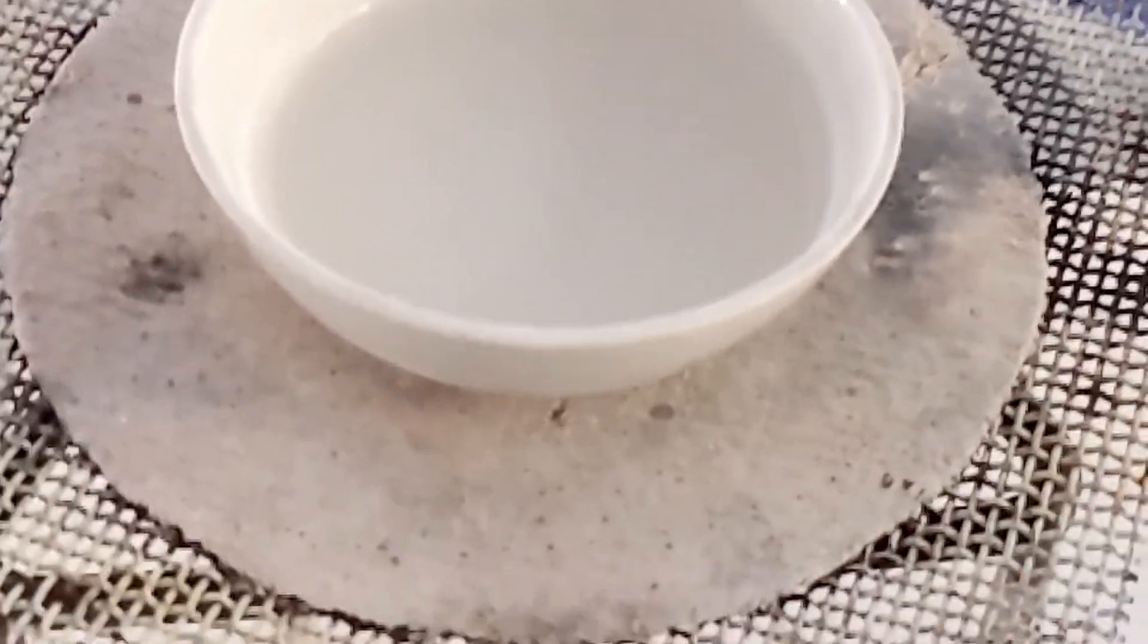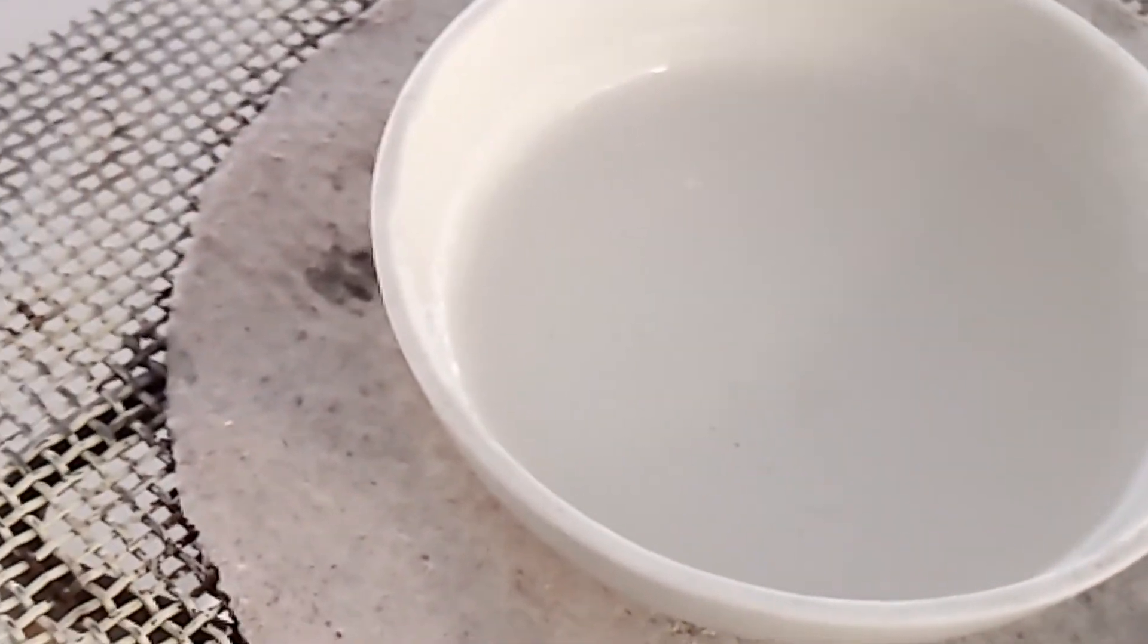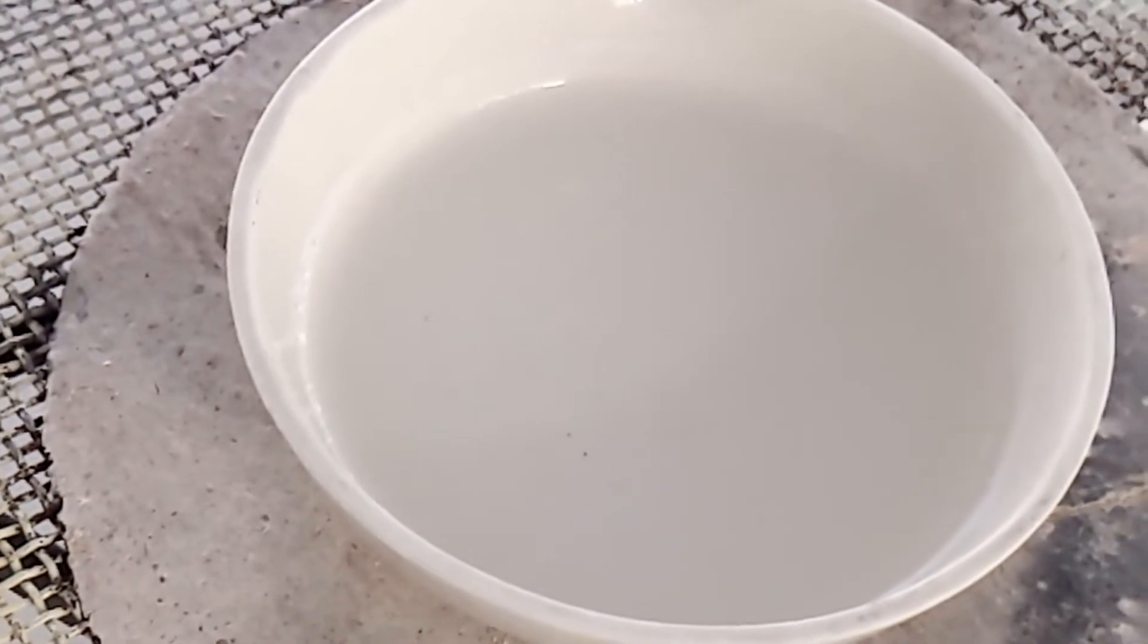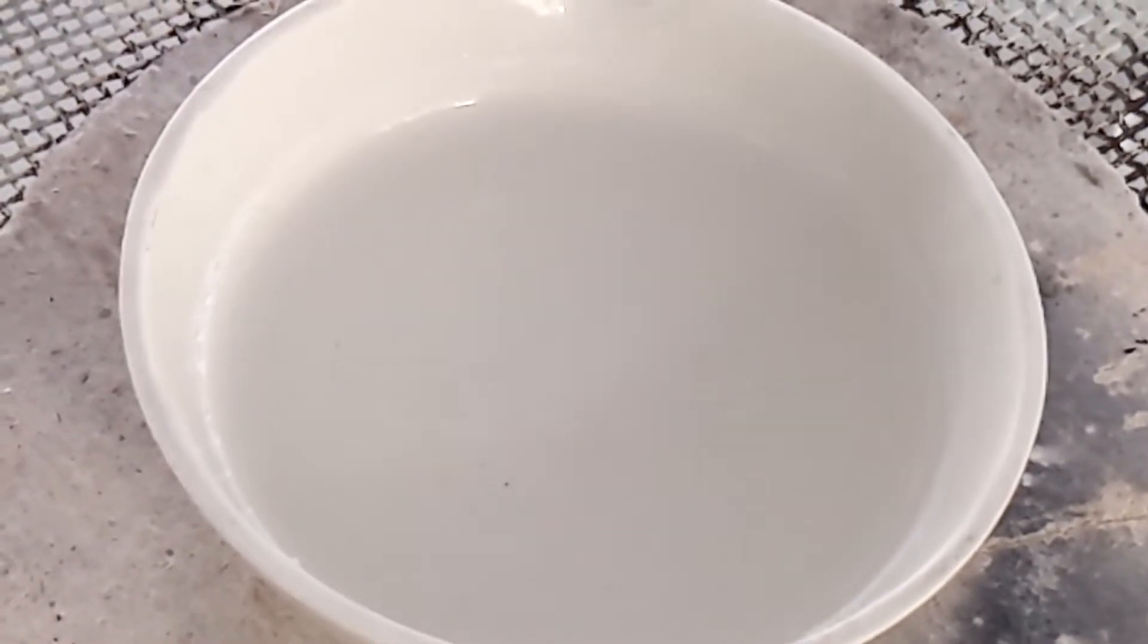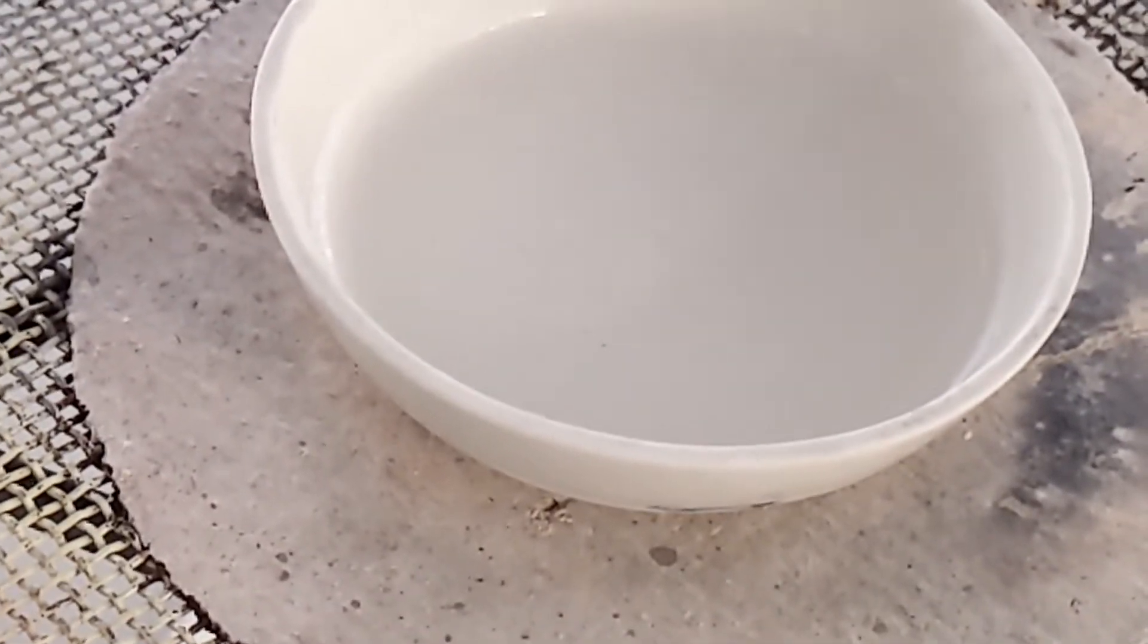And we're just seeing a few bubbles form and some solid around the edge there. So we'll reduce the volume, remove the heat and allow it to crystallize.